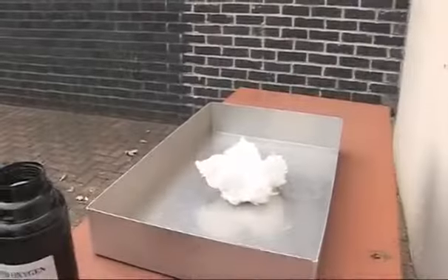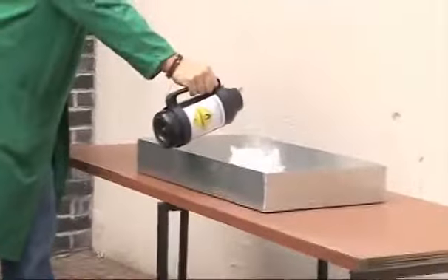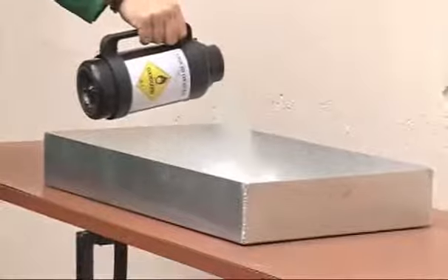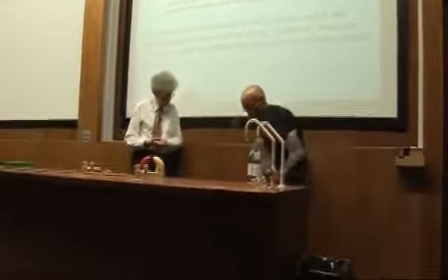And then we're going to fill up all of the void space, so all of the space between the cotton particles, with oxygen. So you might want to stand back after this bit, Brady. So here we go, here's our liquid oxygen. Do you want to come in and zoom in on, see me? Okay, so here you can see the lovely blue liquid oxygen colour going into the cotton wool particles. Let's try the same thing with liquid oxygen. So, careful of my shoes.